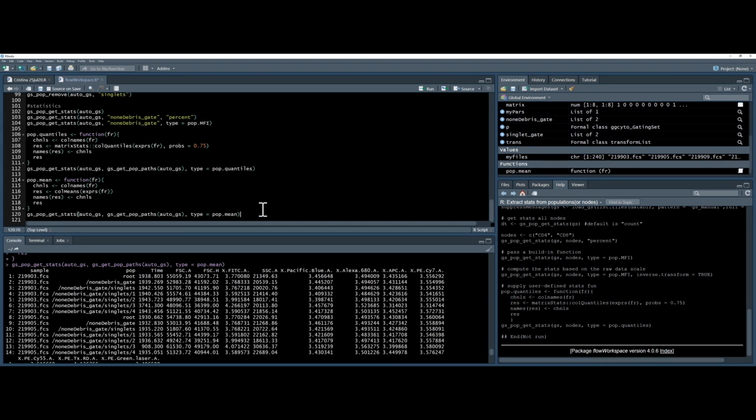Okay, that's it. If you want to put these into a CSV file, use the write CSV command, which is another base R package. And yeah, that's it. Just play around and definitely look at the documentation here and search Google, look in the Bioconductor pages. There's lots of good examples and tutorials. Just be aware that in the last few months, all of these names have changed. So you will get an error if you type in the wrong one, and it'll tell you which one to type in.